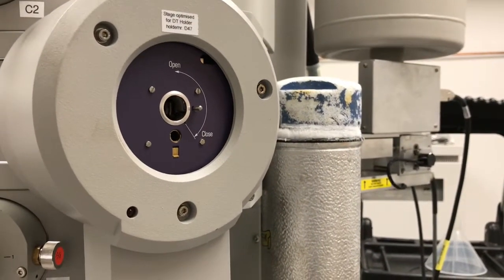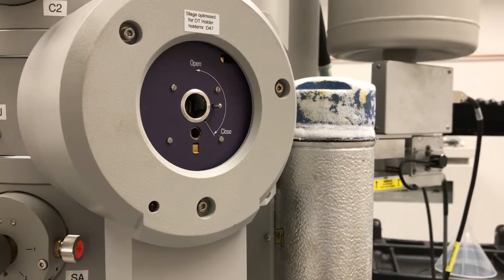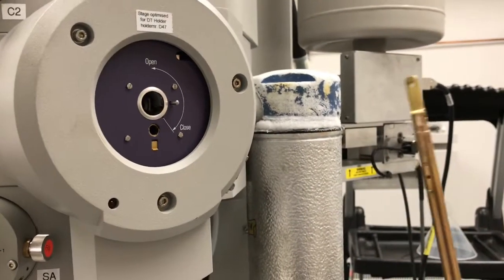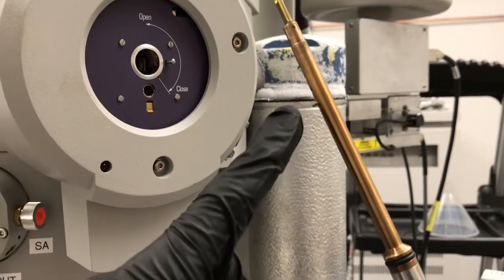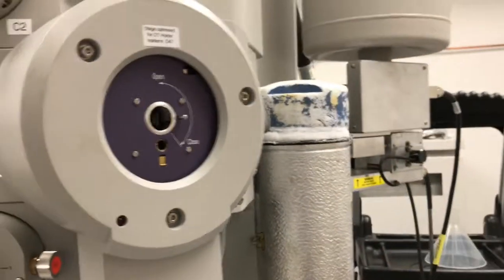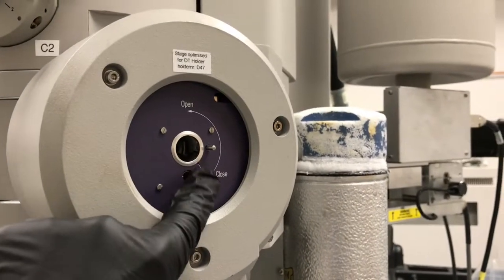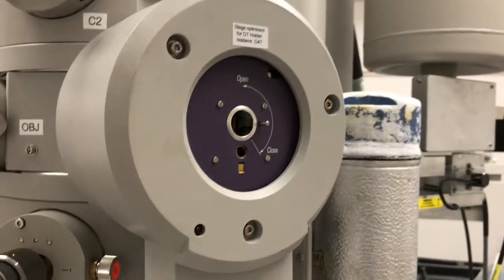Where people most have problems with insertion is that they don't line up the holder properly when they're inserting it. On the base of the holder, not the base rather, but the shaft of the holder, you can see the pin here. What's critical is that that pin is lined up with this line. If that's not lined up properly, you can potentially cause a crash.